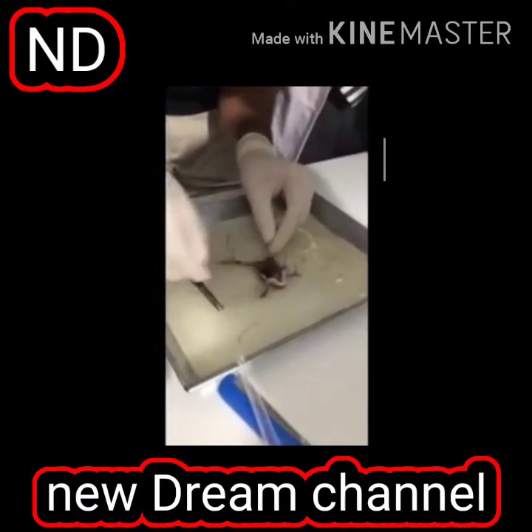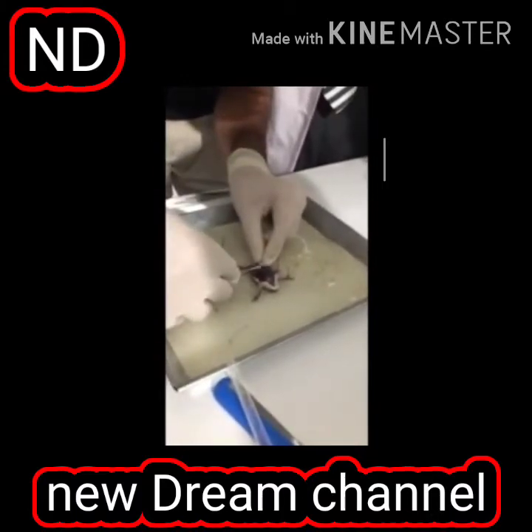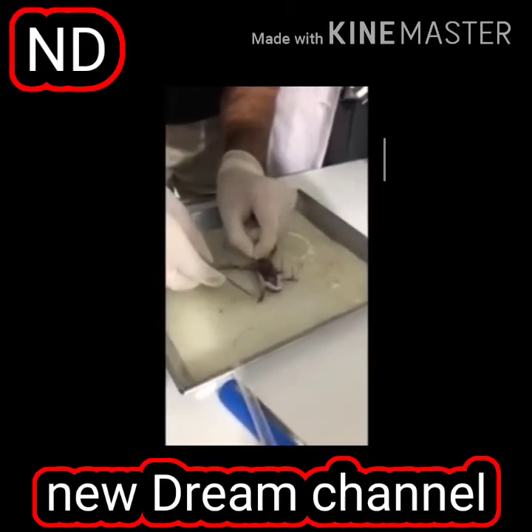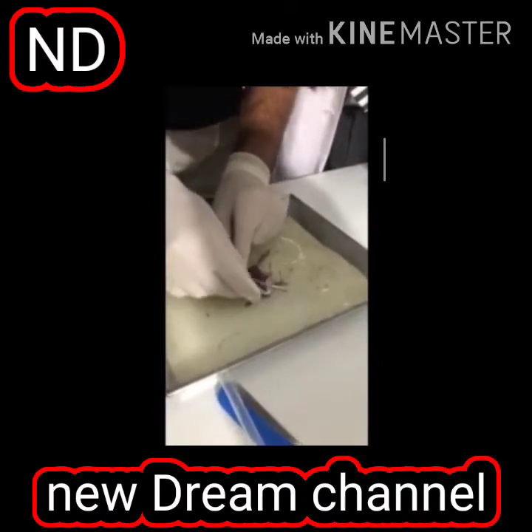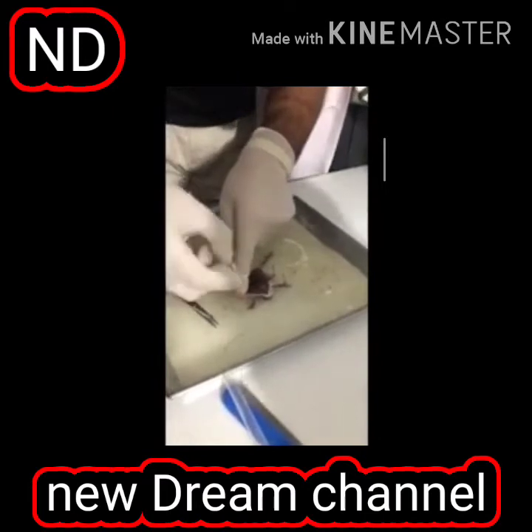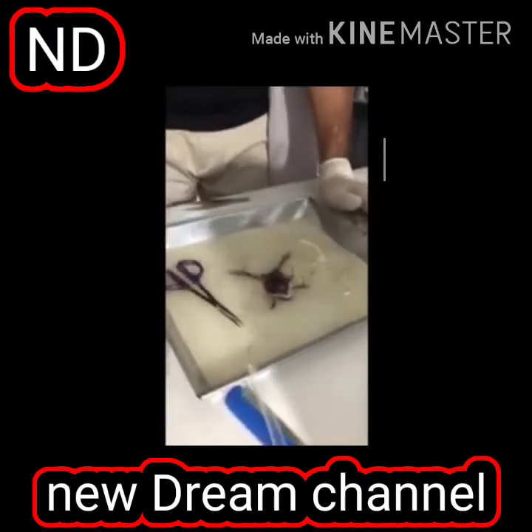I can make the clear dissection here. This is the way of dissection of frog. We will pin it. Pin करेंगे. We'll pin it.